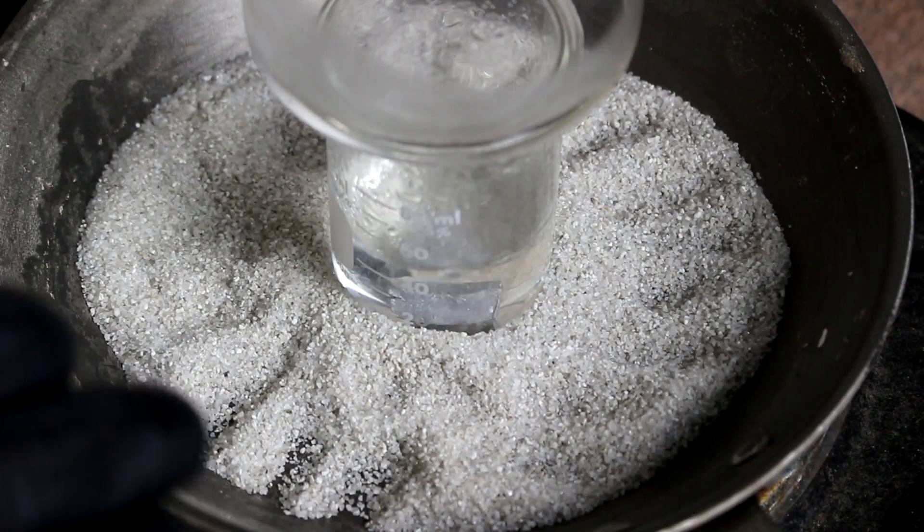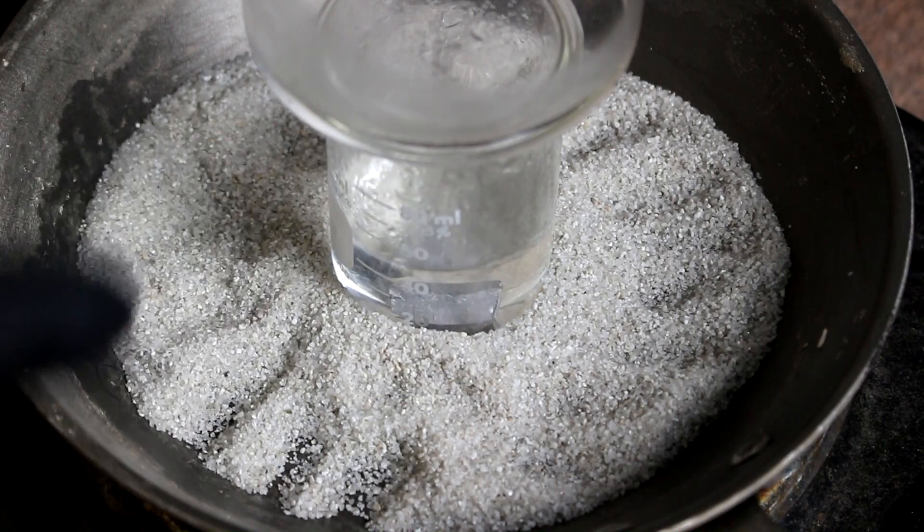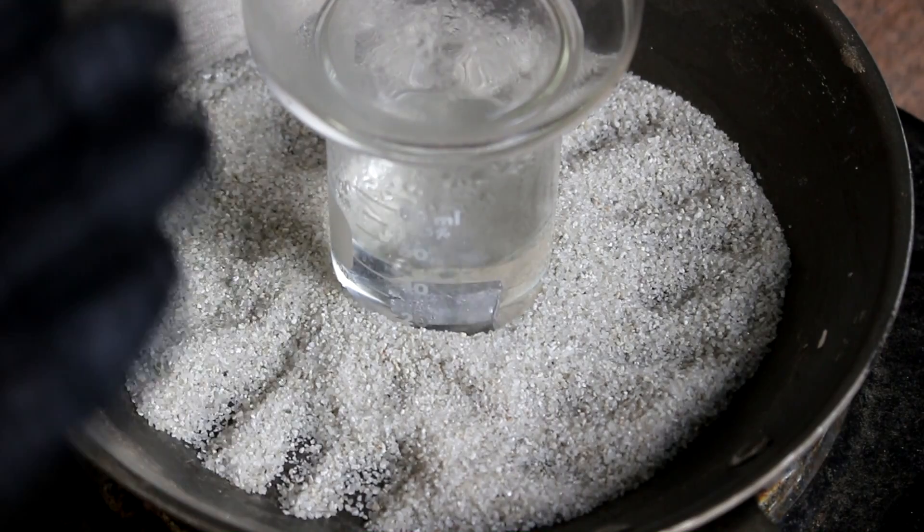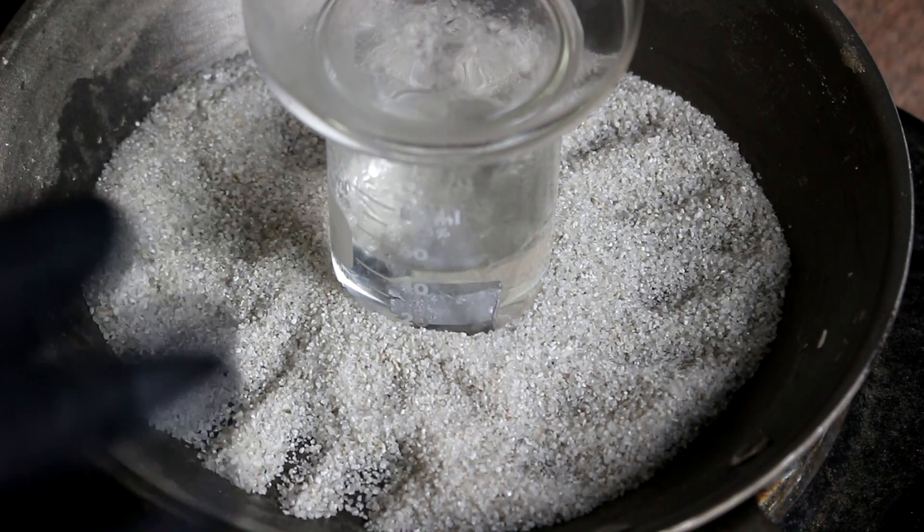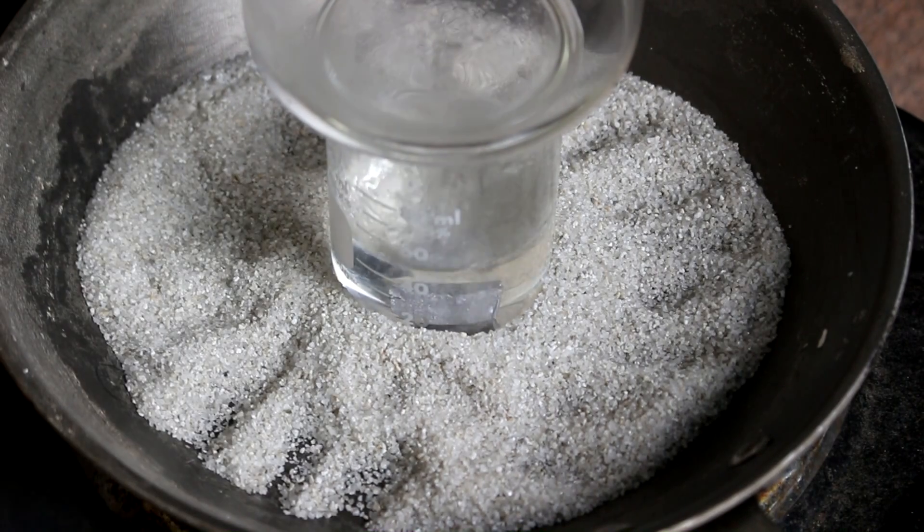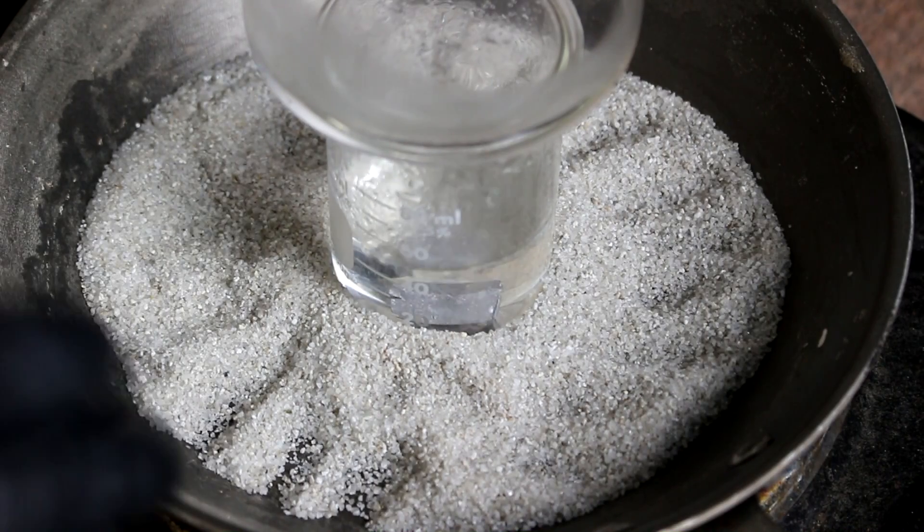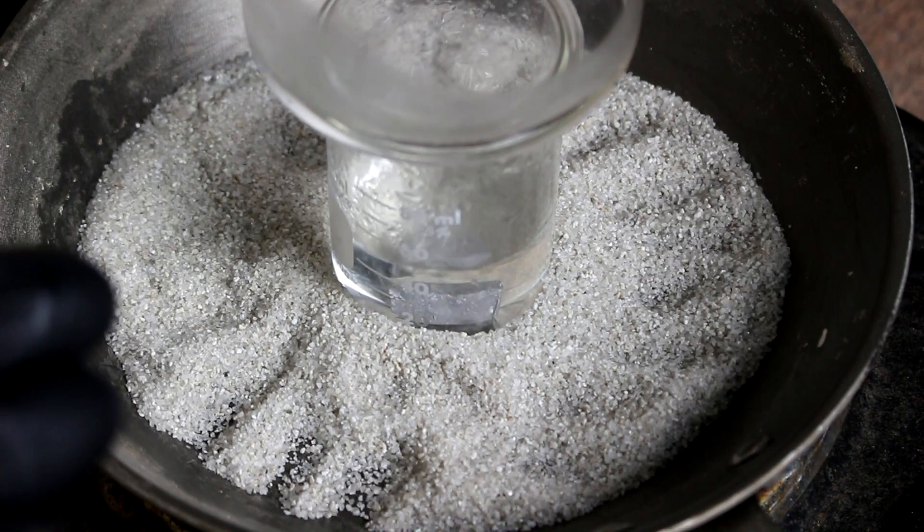But anyway, it didn't seem to react until I got the solution very hot and at those temperatures the formic acid would want to leave so I put a cover over it to help reflux the acid back. But there we go, it's finally reacting. Now I guess I'll just let it sit here for a few hours.